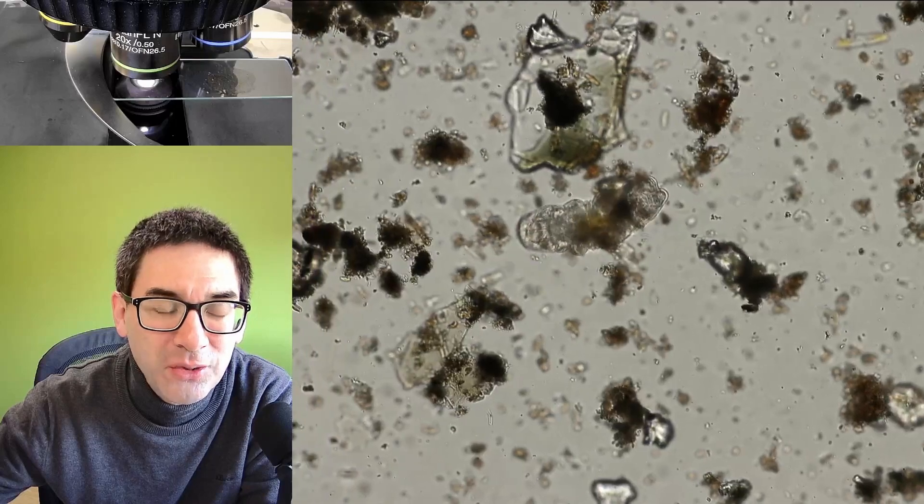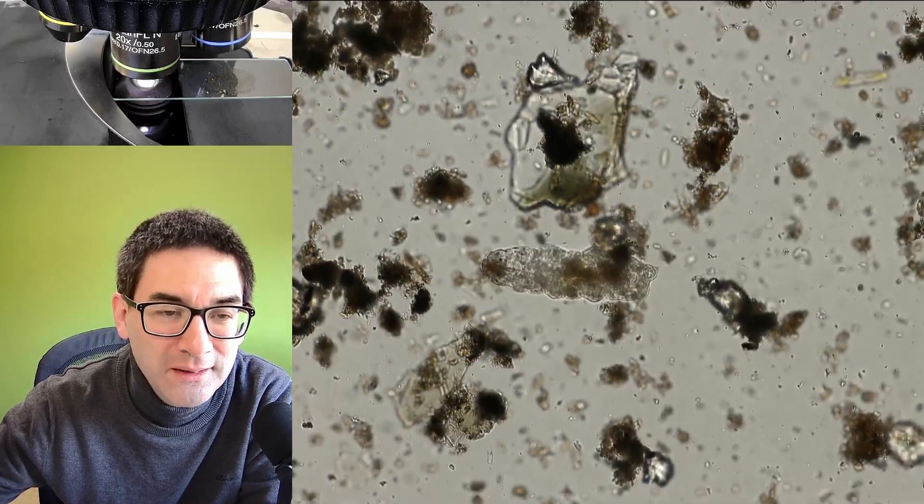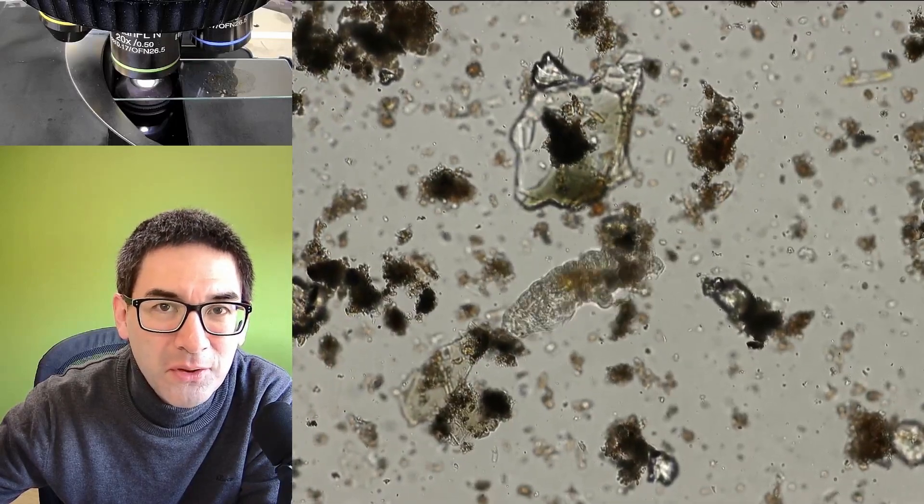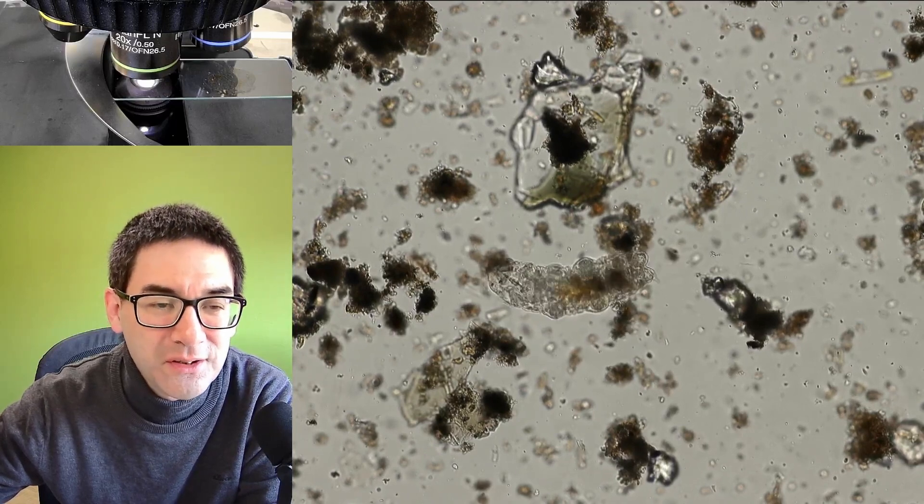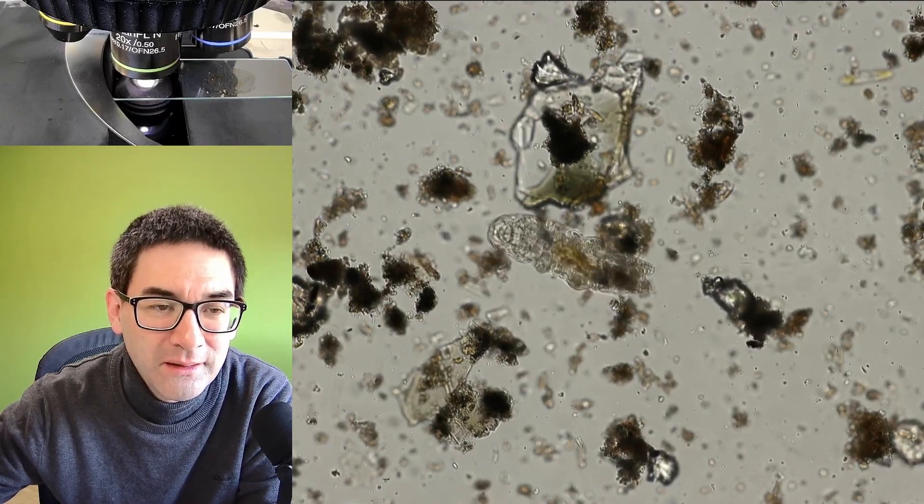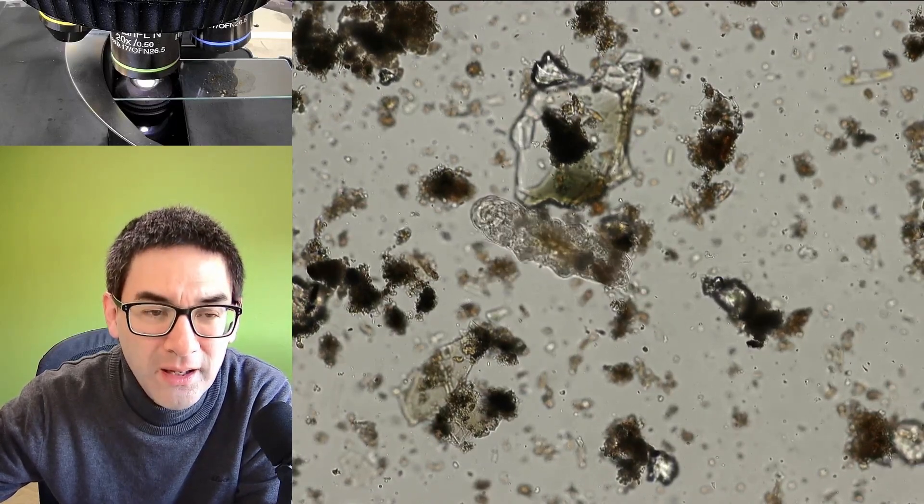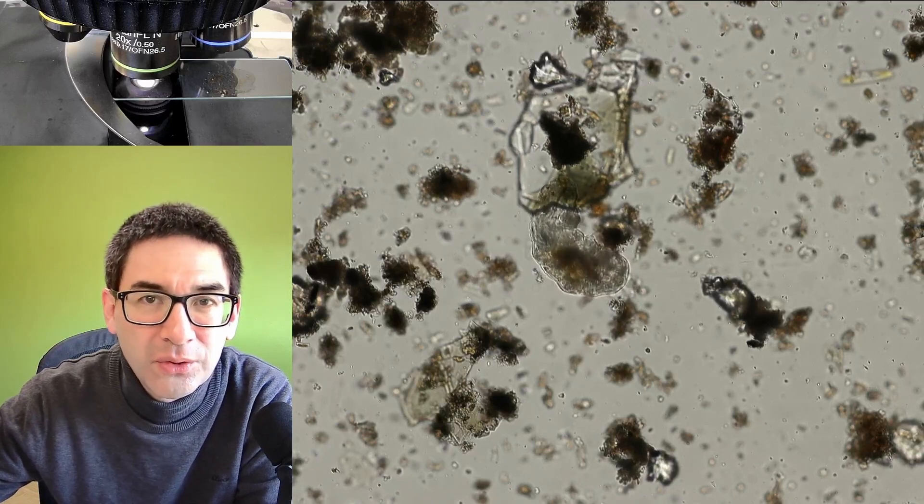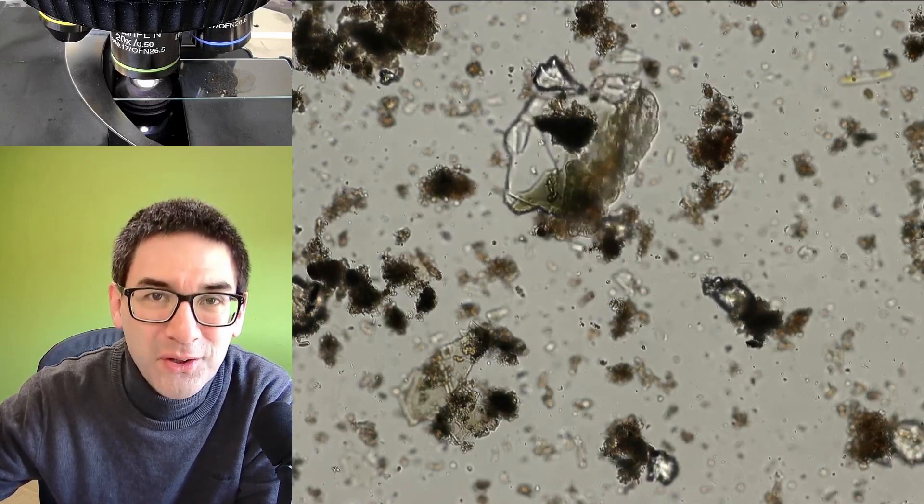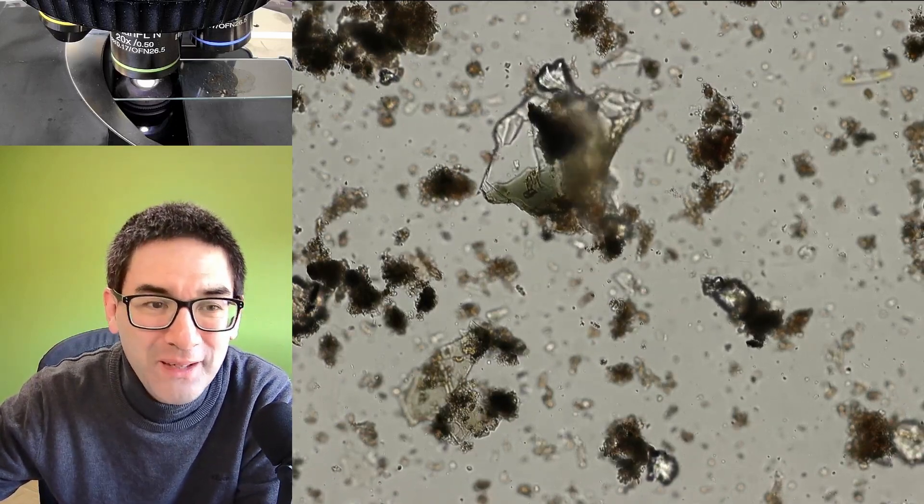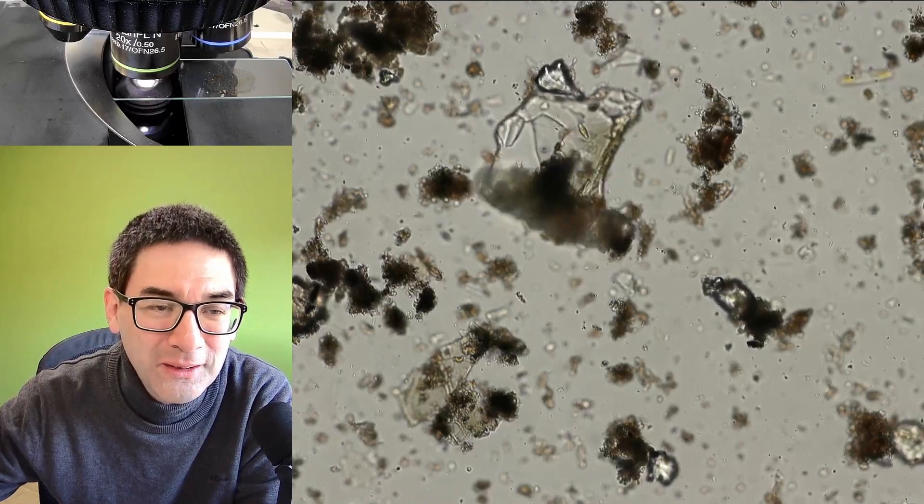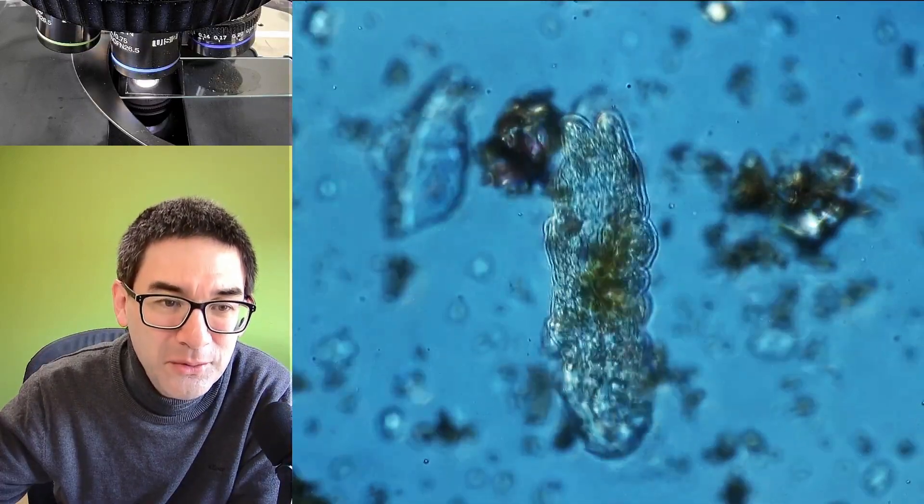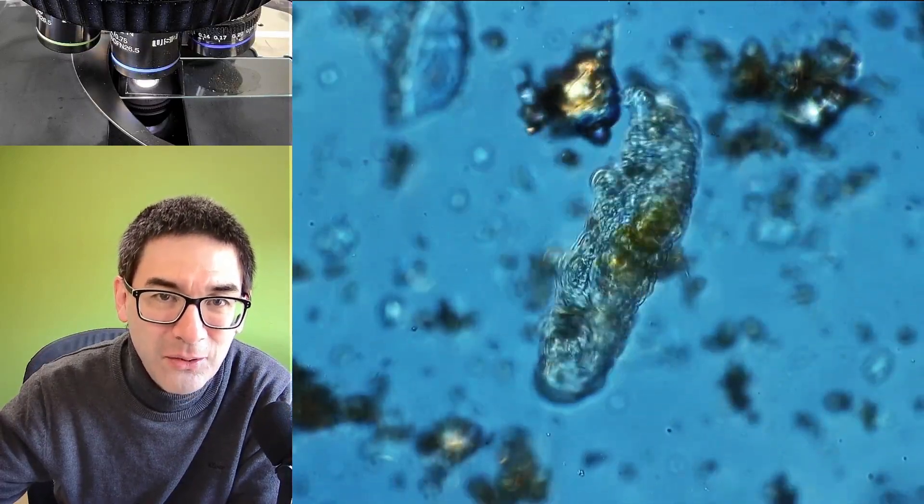So I did now manage to isolate the tardigrade. Here now it's a little bit better visible because there are less particles surrounding it. And there is no cover glass on top so I have to be pretty careful that I do not contaminate my objective because I do not want to dip the objective into the water.